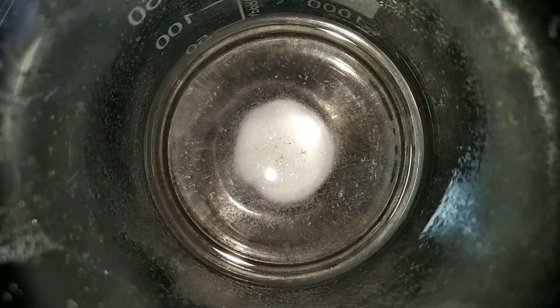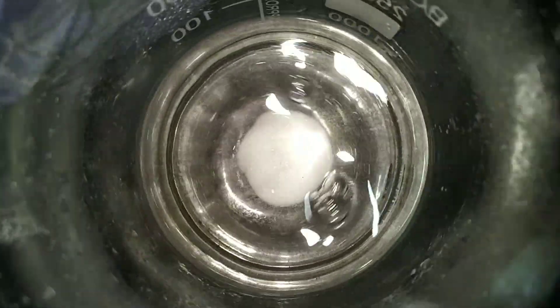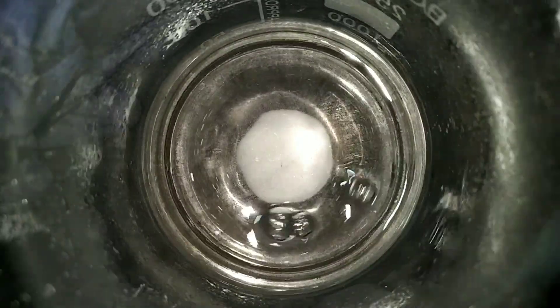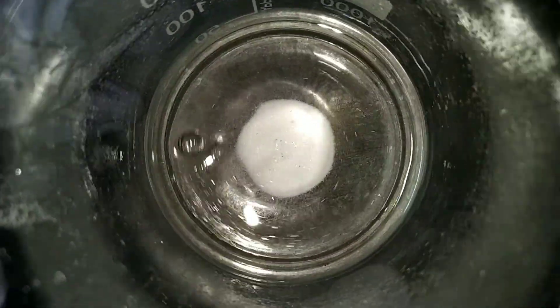After all the lead pieces have reacted we are left with a clear solution with some undissolved lead(II) nitrate. So I decided to dissolve it by adding a few milliliters of distilled water and then heated the beaker to dissolve all the lead(II) nitrate salt.